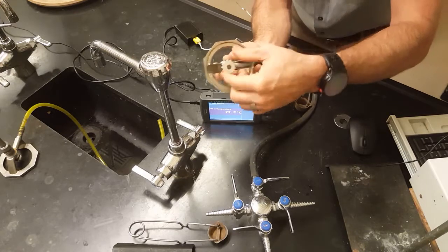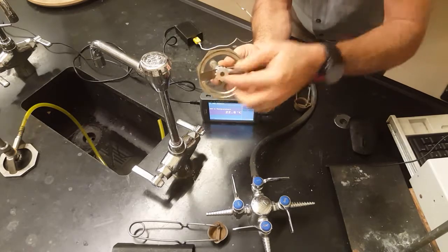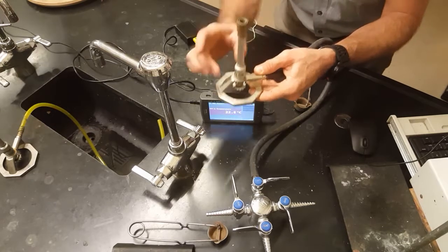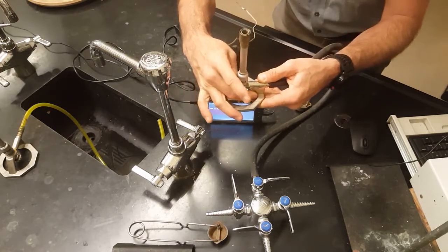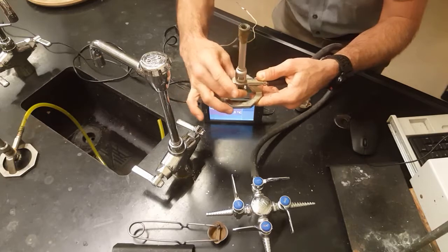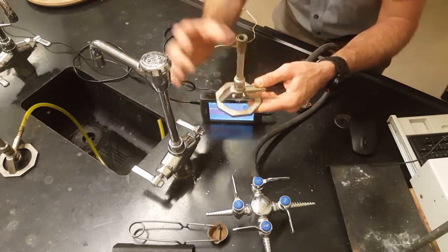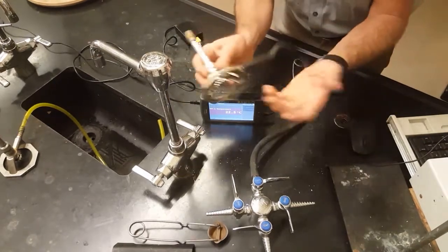What's weird is that it's upside down, so it's really lefty tighty, righty loosey. Lefty more gas, righty less gas. Practice and play with that a little bit so you get the hang of it. That's the point of the lab today.